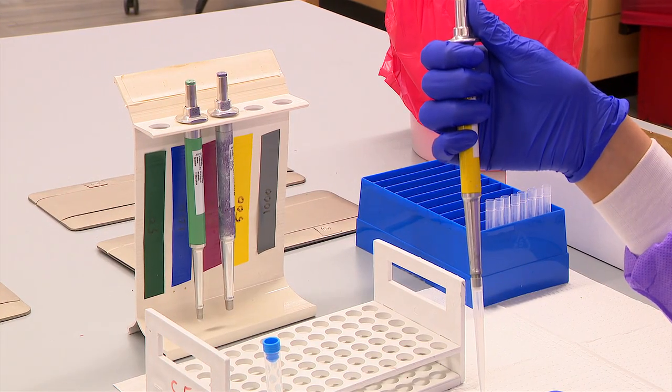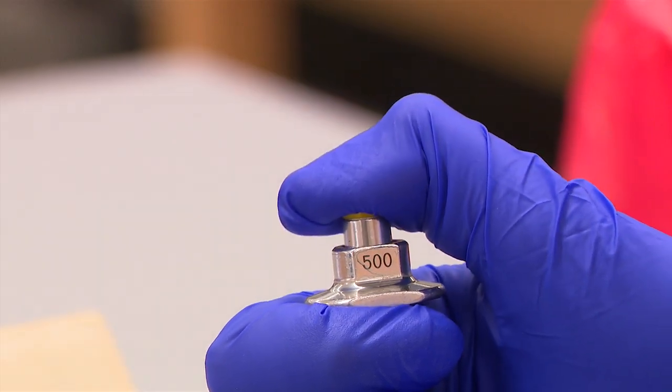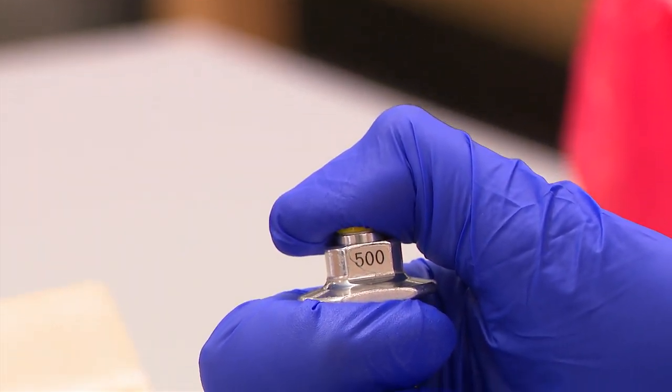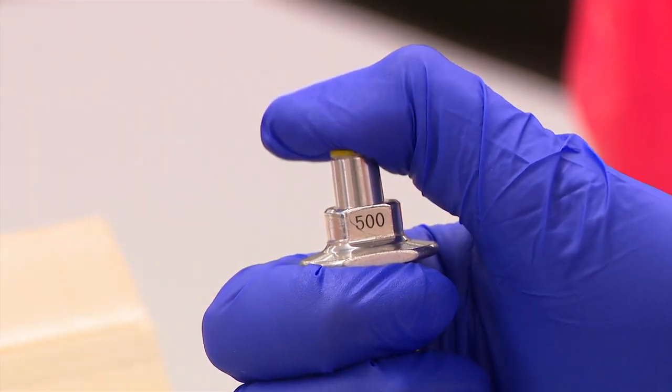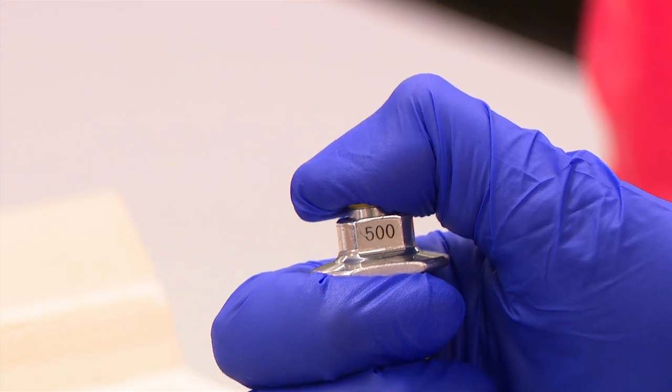Hold the pipette vertically and fully depress the pipette plunger button down to the first stop. Unlike other pipettes, MLA pipettes are a one-stop only pipette.